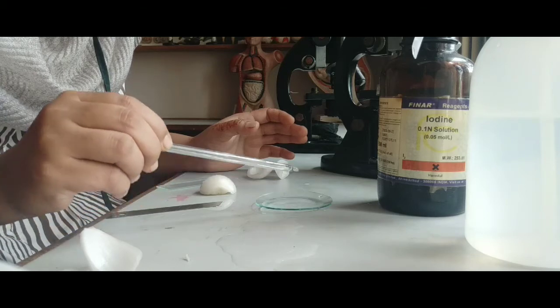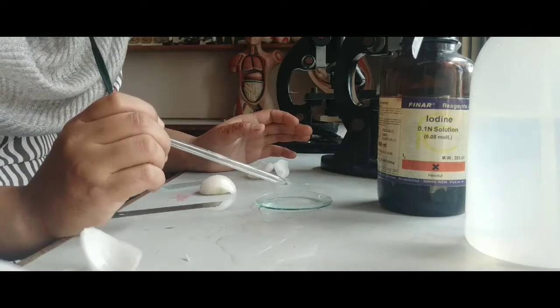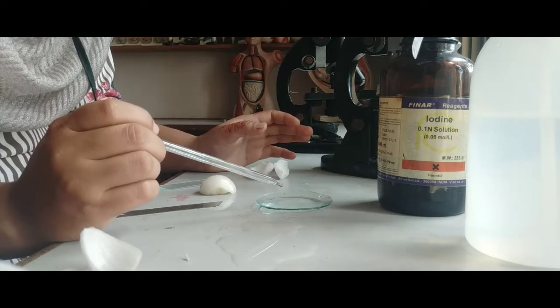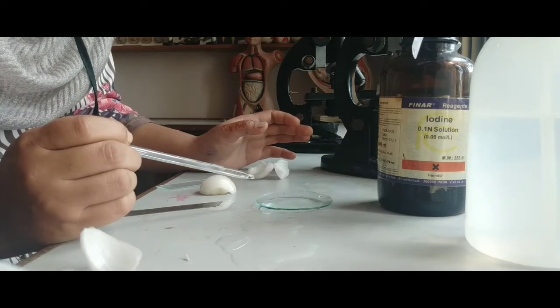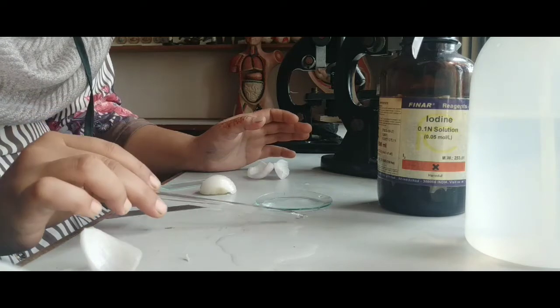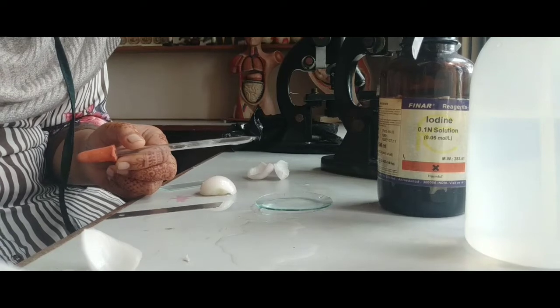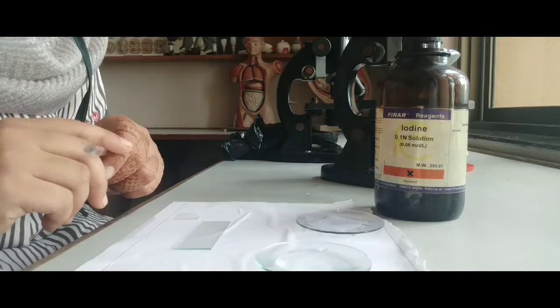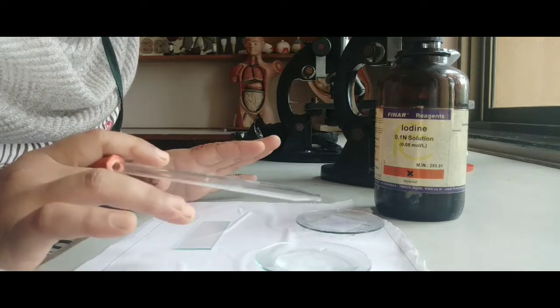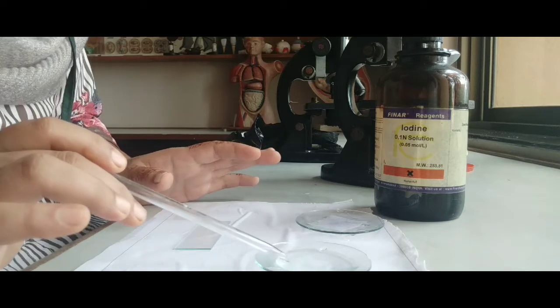Now, as I already told you why this step is very necessary, as the salt solution is there, due to the concentration, the cell loses some amount of water to the salt solution outside of it. So we have to keep our epidermal layer into salt solution for 10 minutes. Okay, so let's come after 10 minutes, dear students. Almost 10 minutes are completed that we had kept our peel into the salt solution.